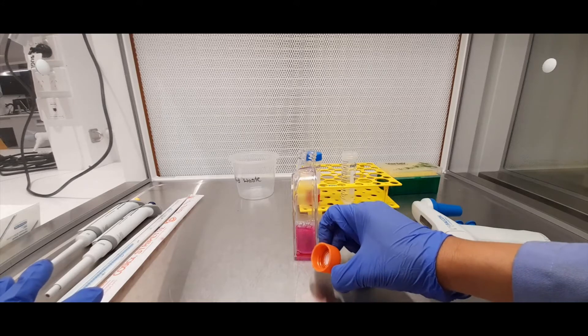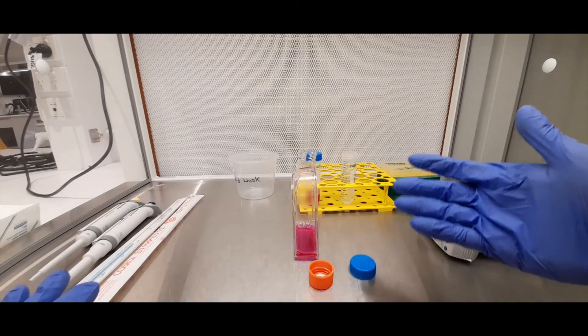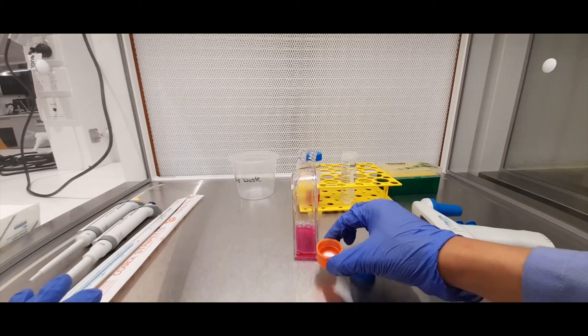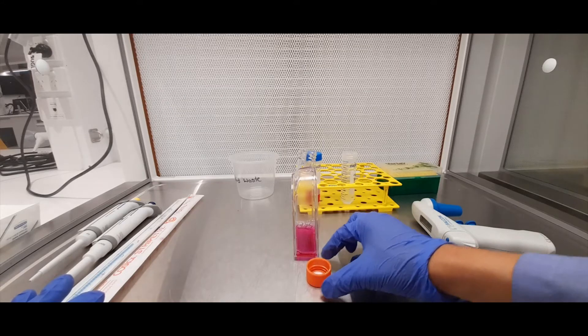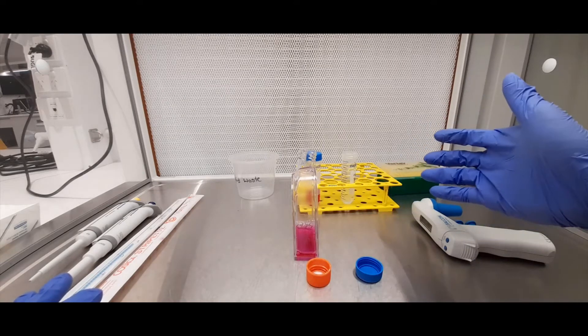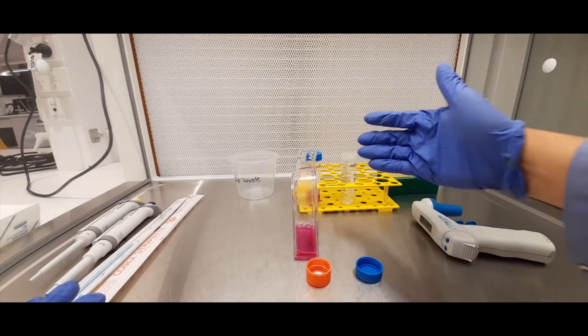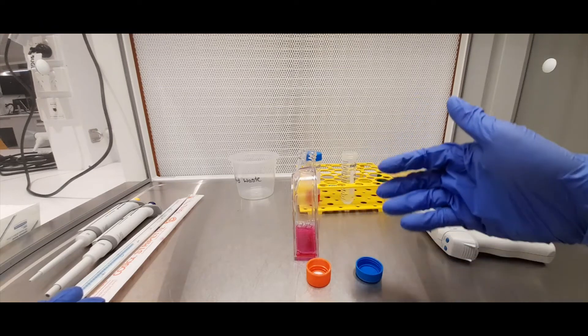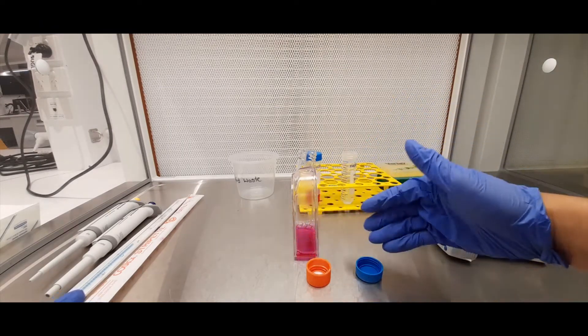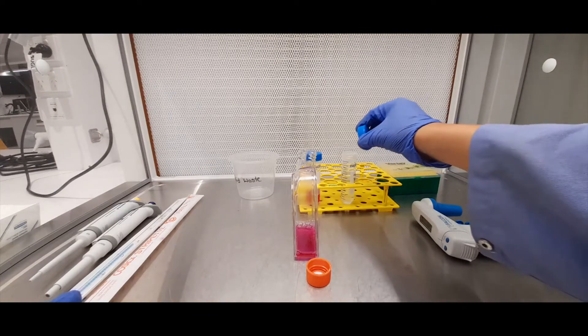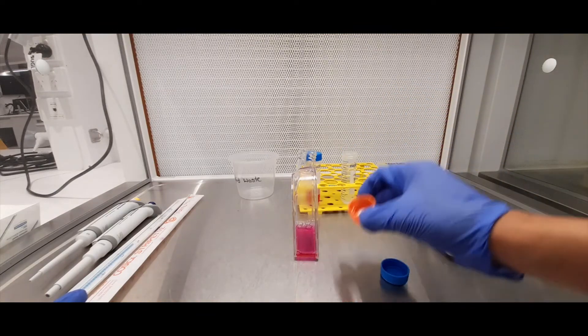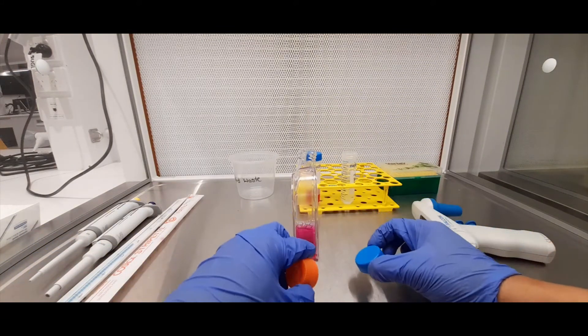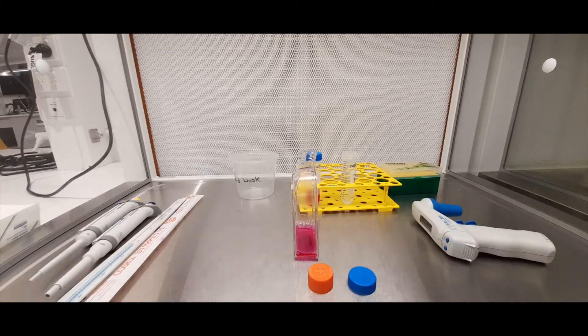It's preferable to do that rather than face up which you might be used to if you've come from a microbiology lab. They always tell you to put your caps face up and then in a cell culture lab like this, all you're doing by putting these things face up is you're allowing the potential to drop unwanted liquids or for different particles and pathogens to fall into that lid. And then if you then cover that back onto your solution or cover this back onto your cells, you're just transferring that contaminant into your cells. So the best practice is to have it face down on a nice clean work surface like that.